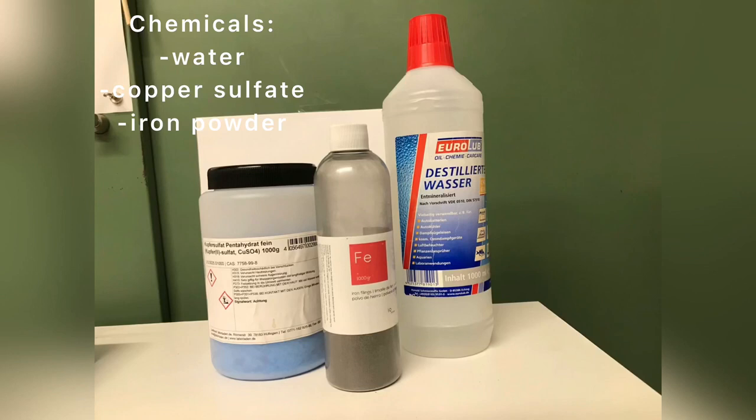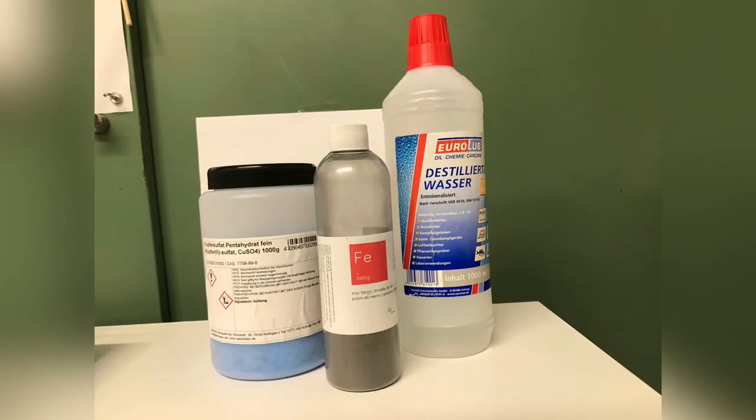After my other synthesis today didn't work out very well, I decided to do a little experiment involving copper sulfate and iron.